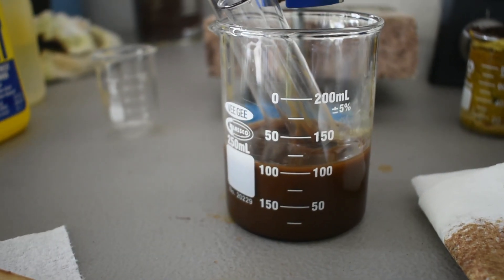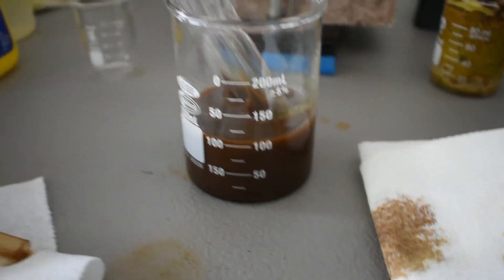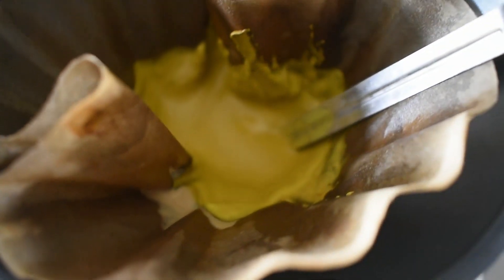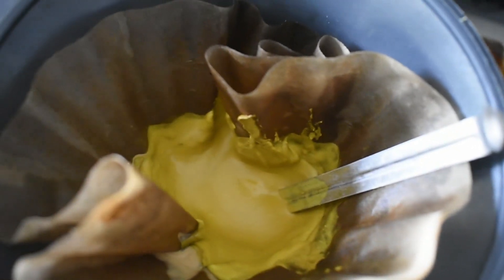It's got a nice brown, gross solution underneath. But we do have a nice yellow product on top. So I'm going to get to transferring this to a vial.